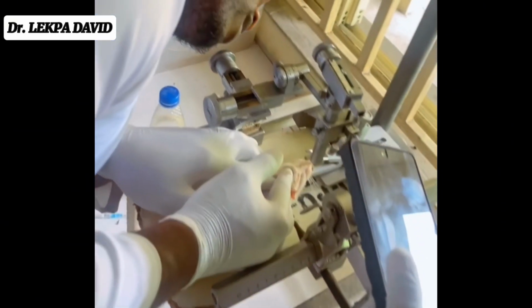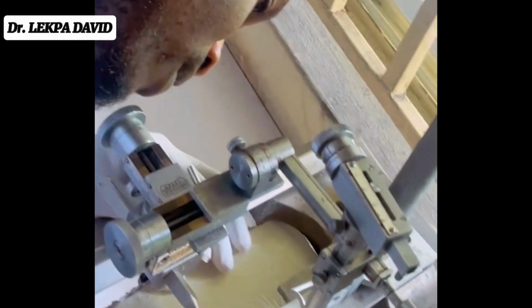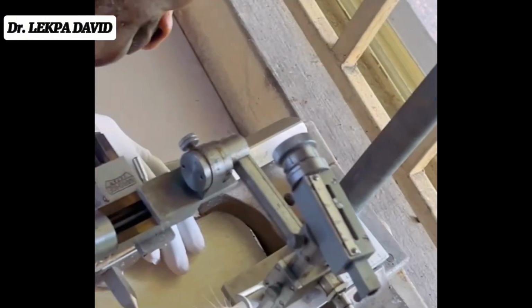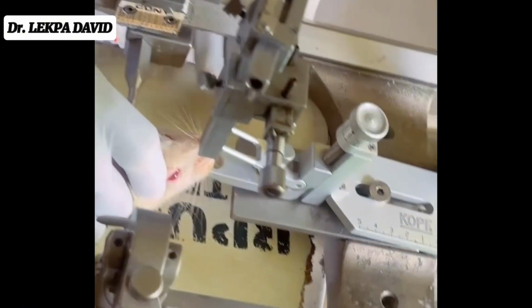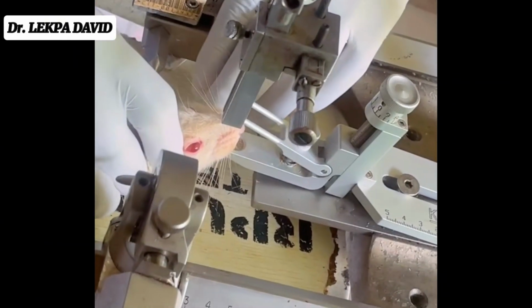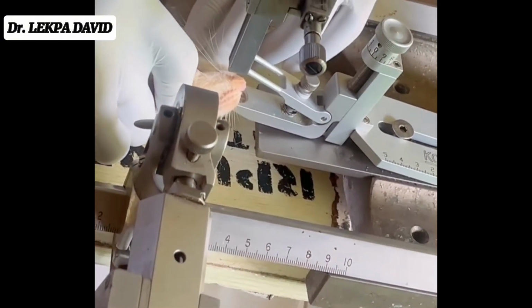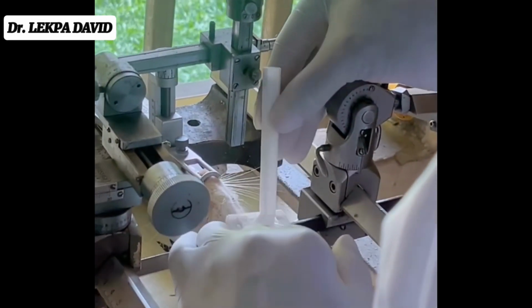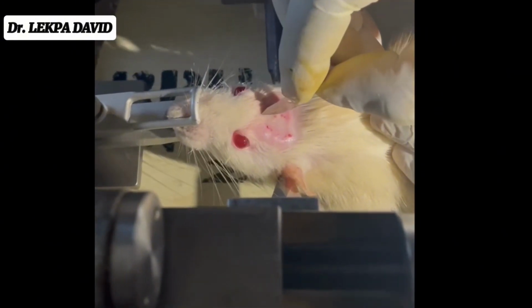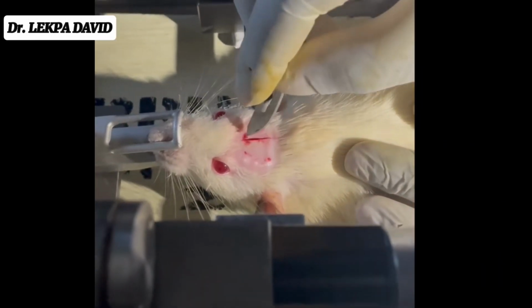After applying the ketamine, we wait for a few minutes so the rat is fully anesthetized. Then you can see me placing the rat into the stereotactic frame. Now this stereotactic frame is missing a lot of important parts which were supposed to be important to this procedure, but we will settle for just the frame. After placing the rat into the frame, we had to shave the part we are going to be using for the surgery. As you can see, it has already been shaved. We also sterilized the shaved part, and as you can see, it has been sterilized.